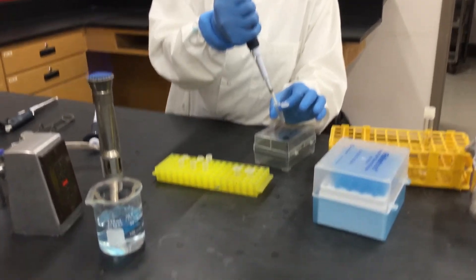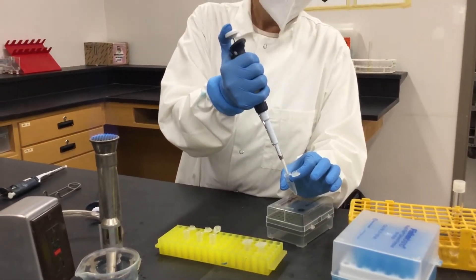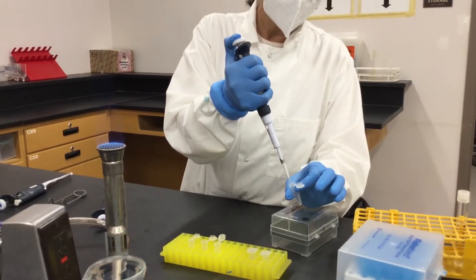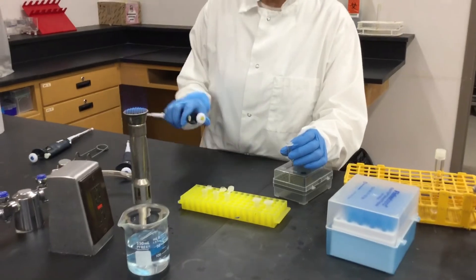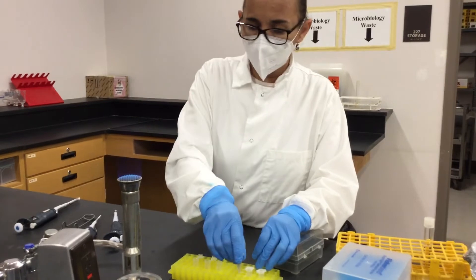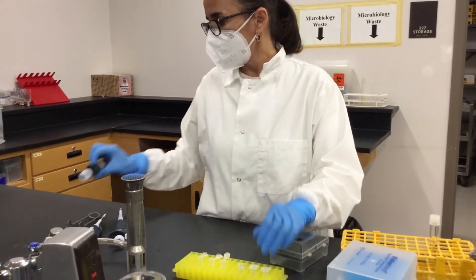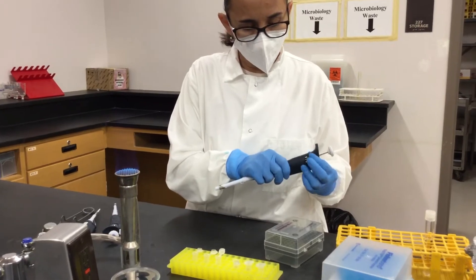See how I'm plunging up and down to mix really well. And then up to this point you are not going to use this anymore, so you just put it in the beaker with disinfectant.